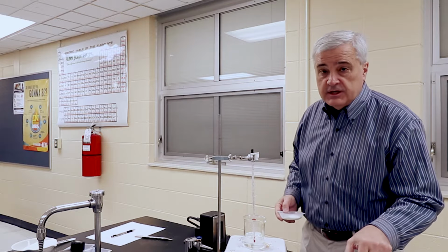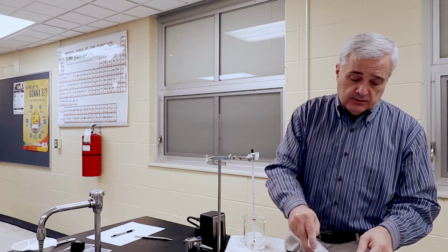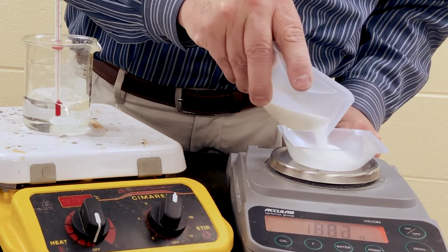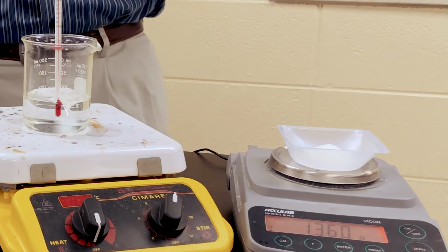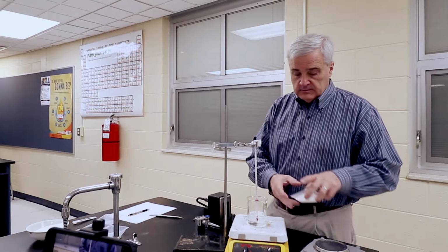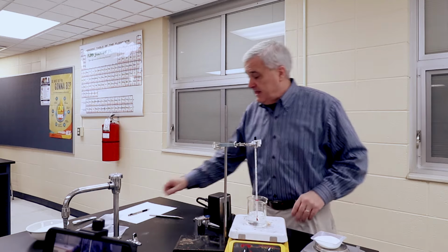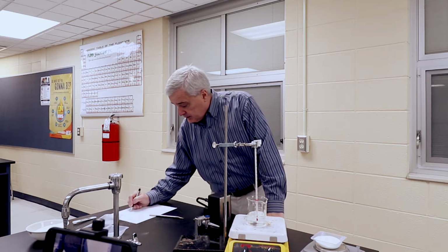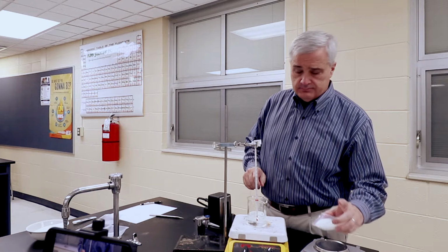All right, we have zeroed the scale. I'm going to put in a large quantity of sugar to start with. I'm aiming for around 150 grams, just based on watching my mom make sweet tea. And it's very awkward. It's upside down. I'm behind the apparatus. This is kind of weird, but we'll make it work. All right, that is 63.13. That'll be our first scoopful, boatful.